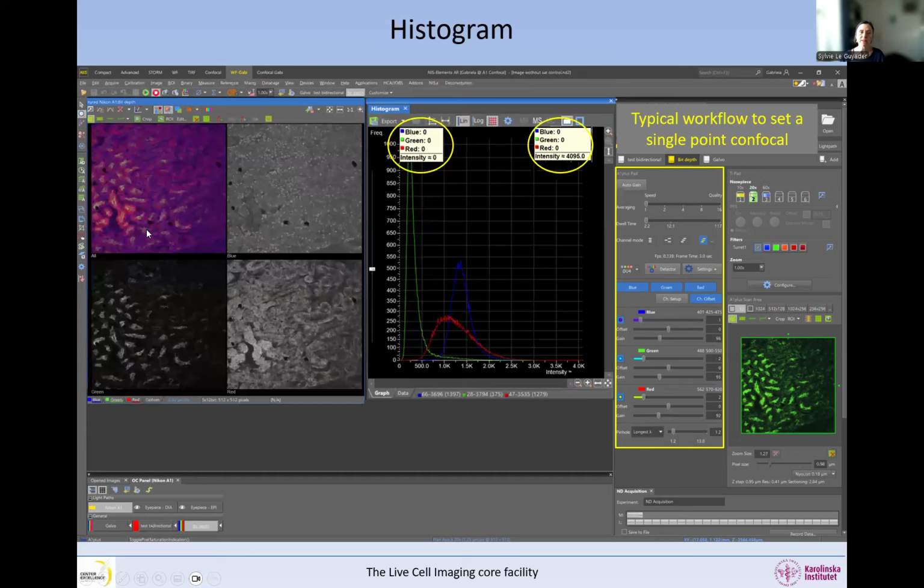And when we do that, this is the type of image that we can get. And now we have no more saturation. So we can see we have 0 pixels that have 0 intensity in any of the images, and we have 0 at the maximum bit depth, and therefore these images are well exposed, and this is the type of histogram that we're getting. So this is what we're aiming at.